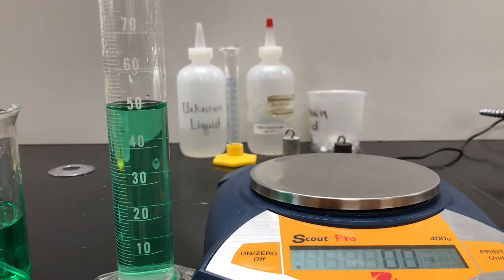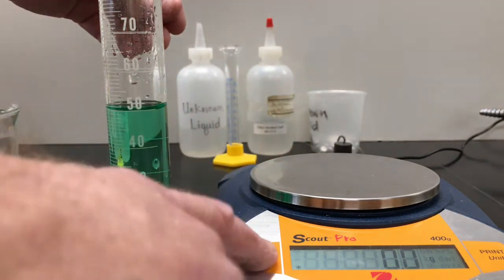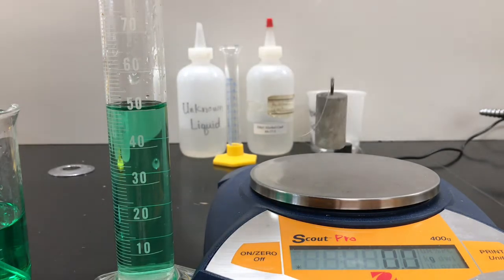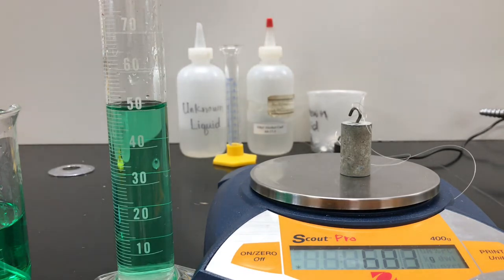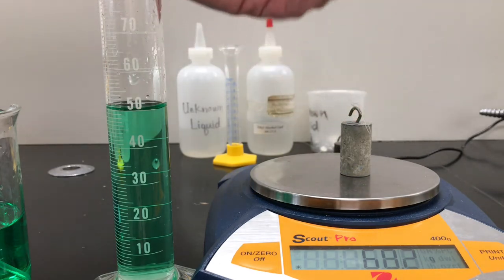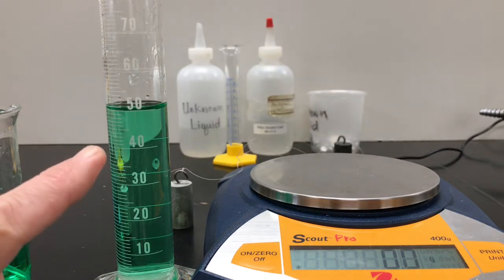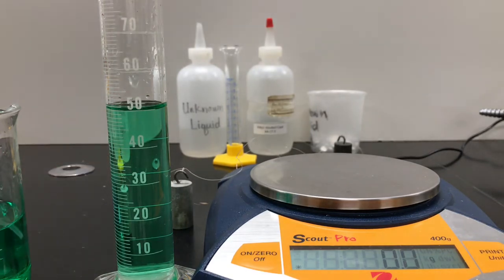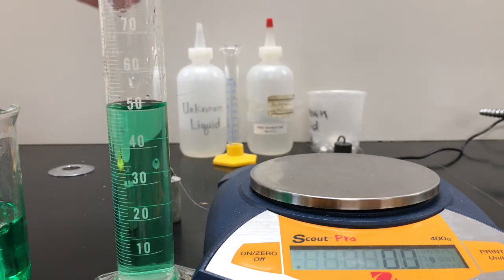I'm going to skip to the zinc since I'm doing the solids. Again, re-zero the scale. 68.2 grams. All right. Now, again, let's double check our instrument. Our water is our instrument here, and we're still at 50. I'm a little short, maybe a drop or two, because when I took those other metals out, it took a little bit of the water with it. There we go. So we're at 50 milliliters again, 50.0.